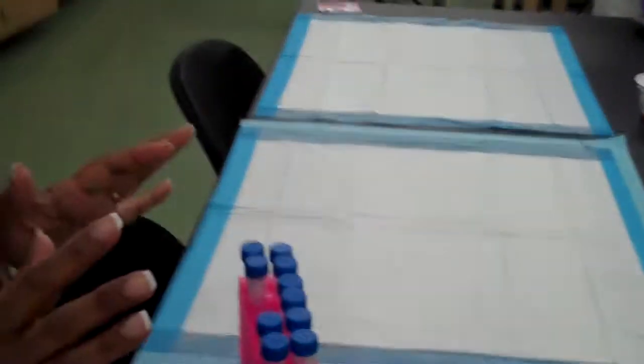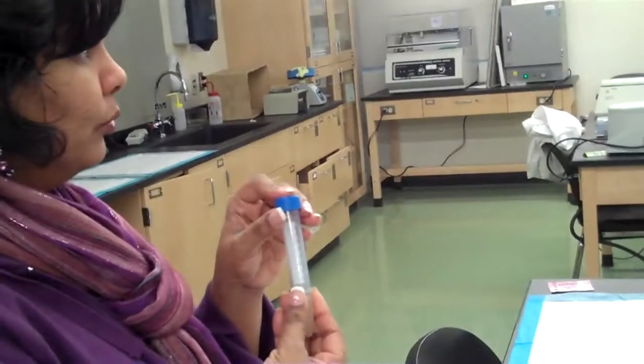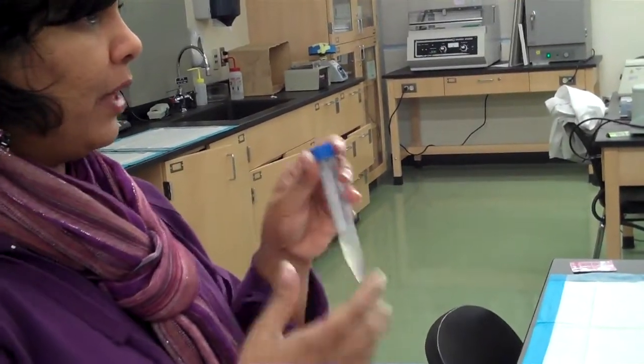So what I'm going to do, I think I started a broth yesterday, but I think I might have thrown it away, but it doesn't matter. We should have somebody do it, and then we can record how that is done.